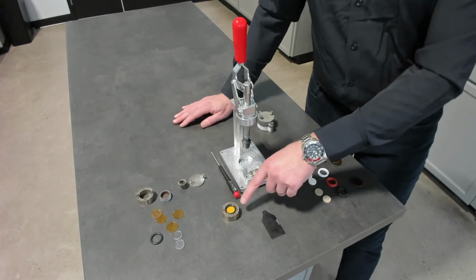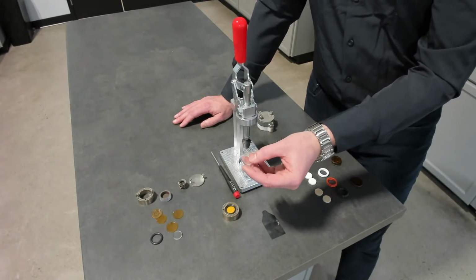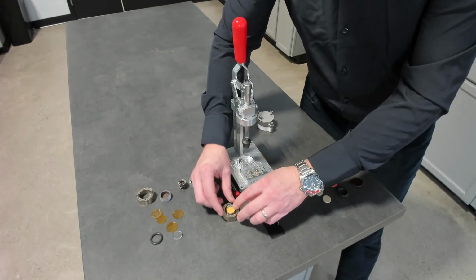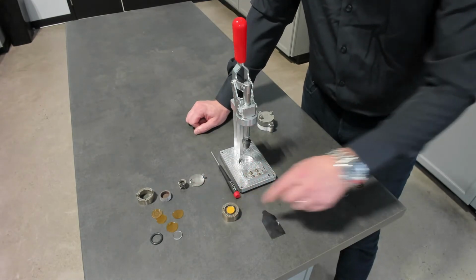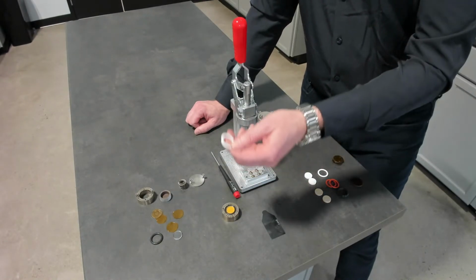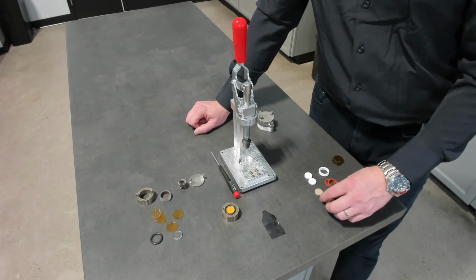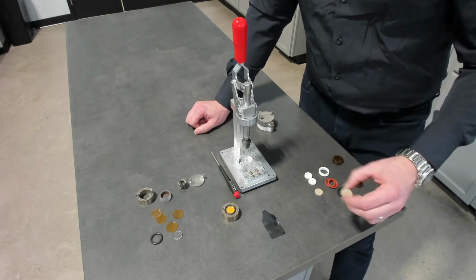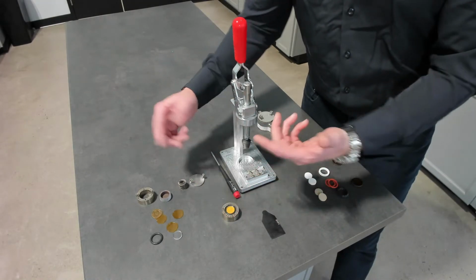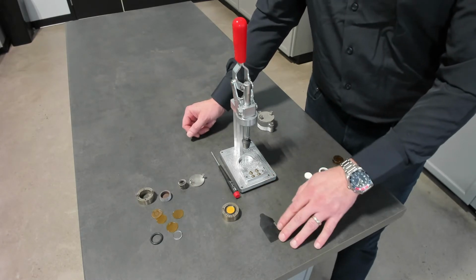So the sample setup is one layer of Kapton. We use an O-ring to contain the sample as it's going through the melt. In this case, we have these discs that we've machined to polycarbonate. This is the sample we're going to measure through the melt. And we have different O-rings of different types, silicone and Teflon, and those all give us different temperature ranges or compatibility with the types of materials we're measuring. If you're measuring PEEK through the melt, you would use the Teflon O-ring. So it basically contains the sample in contact with the sensor.